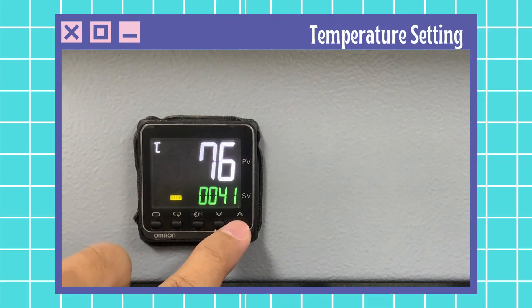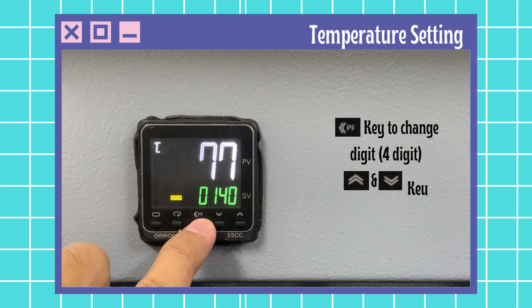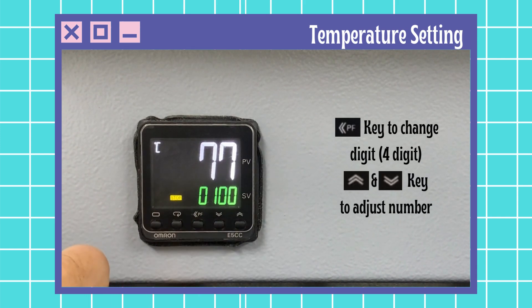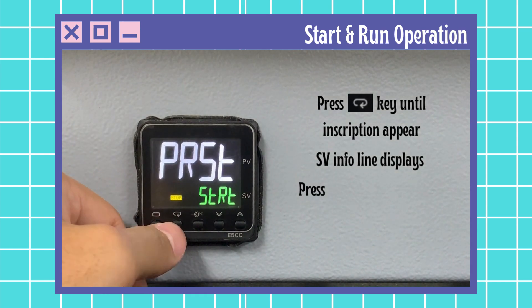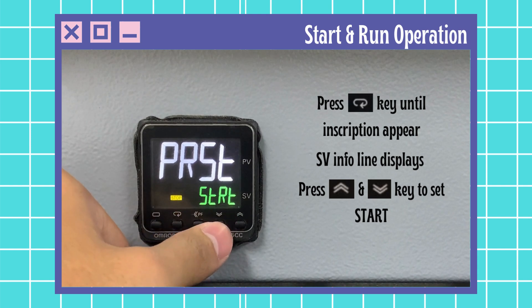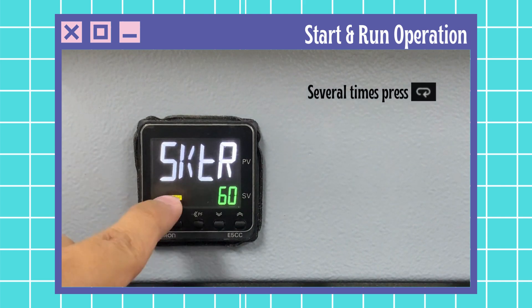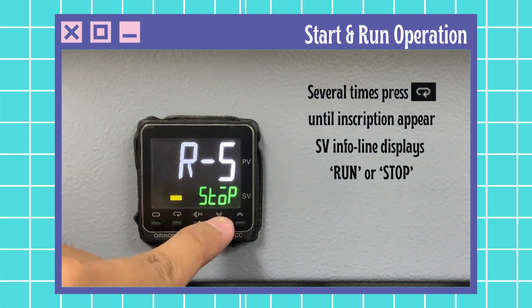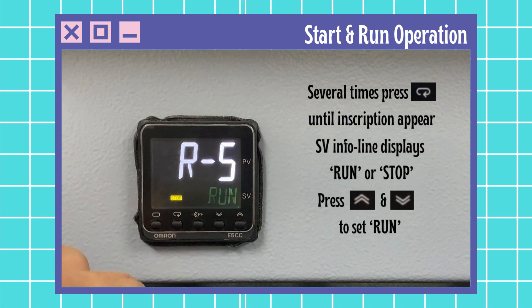Temperature setting: set the desired temperature with the down and up key. For example, set to 100 degrees Celsius. Press set key to change digit and set parameter with up and down key. Then start the operation by pressing the mode key. The inscription will appear: set value, info, reset, or start. Press up and down key to choose start and wait for a moment for it to set. Press mode key several times until inscription RS appears, then press up and down button to set run. Wait 2 to 3 seconds for it to set.